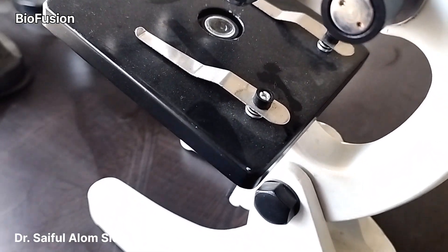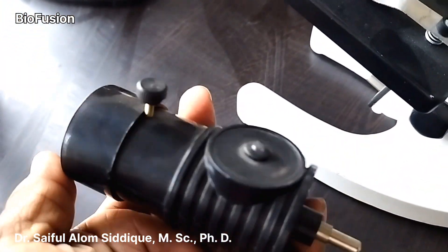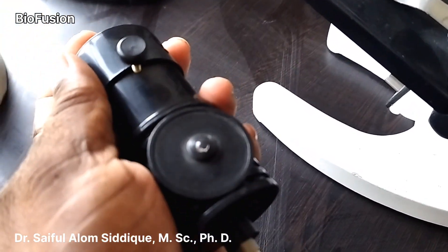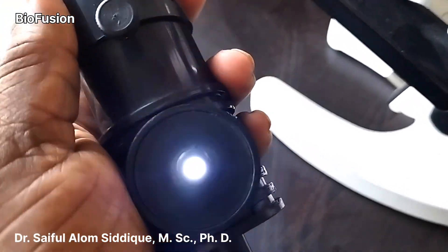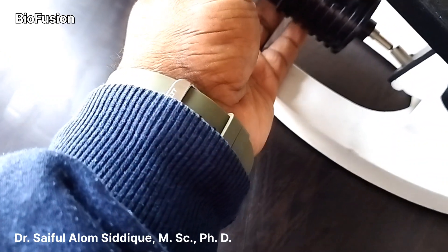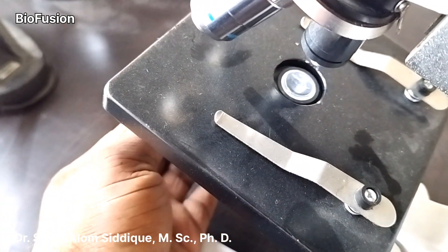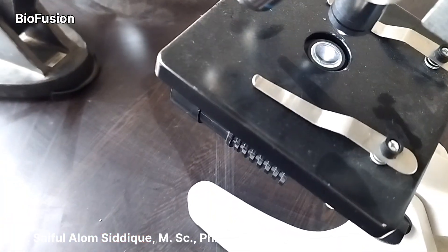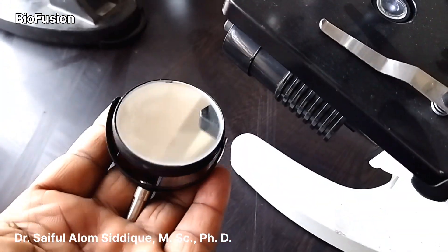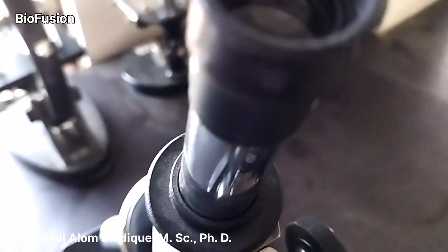If you have already noticed the parts, you will see the playlist in the video. The first is the light source — this is an artificial light source. The light is not limited. You can also see the mirror from this view.